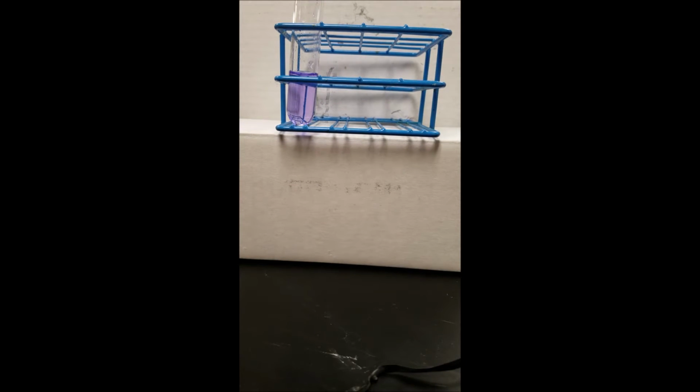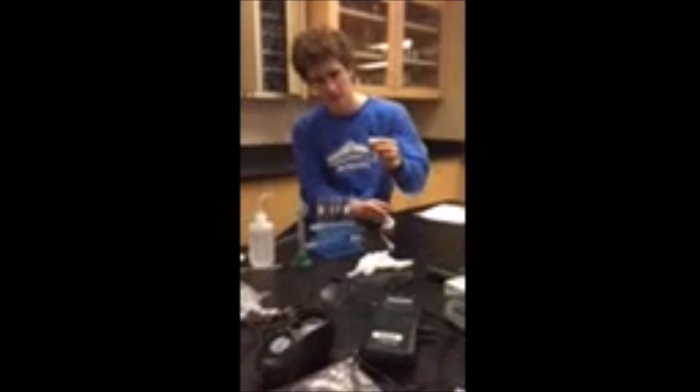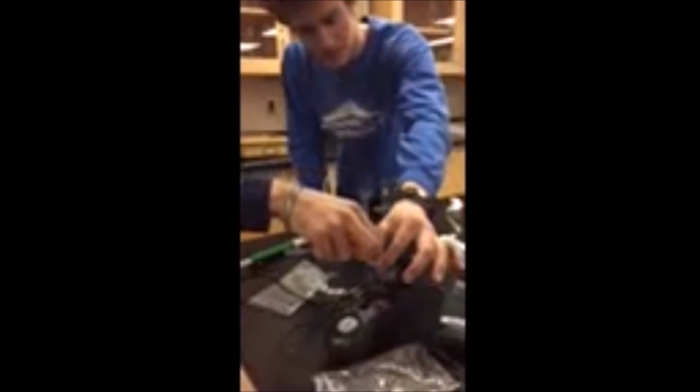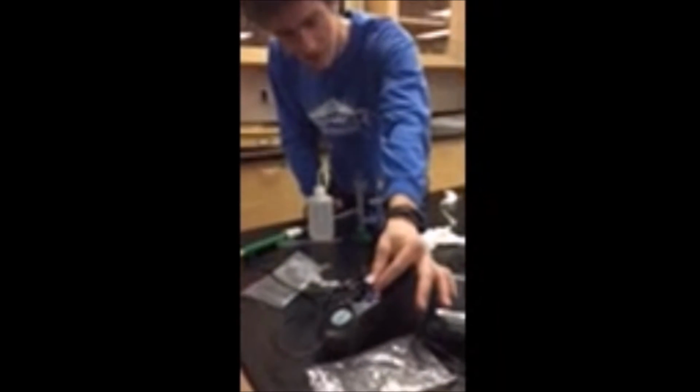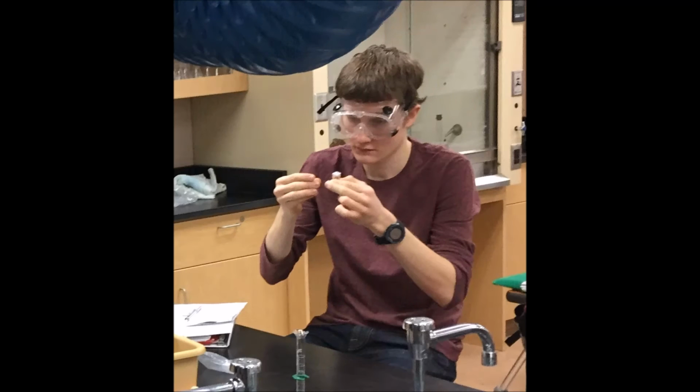This also started a reaction between crystal violet and sodium hydroxide, so we quickly transferred the solution into a cuvette and collected the absorbance over time. It is important that sodium hydroxide is in excess, so all the crystal violet will eventually get used up. Using the calibration curve, we could then use absorbance data to analyze concentration over time. The concentration over time graphs could then be analyzed to find the reaction order of crystal violet.